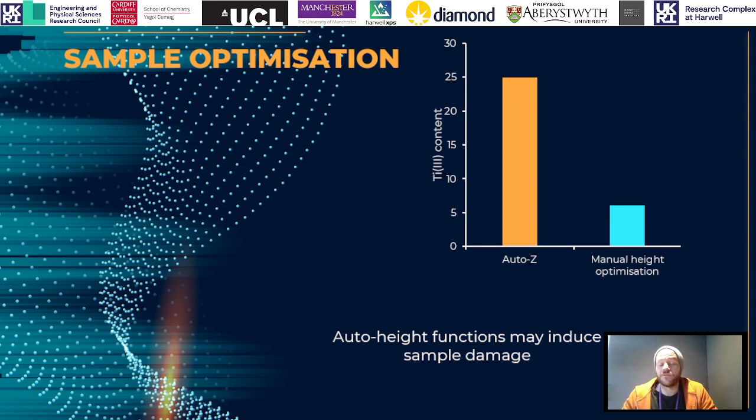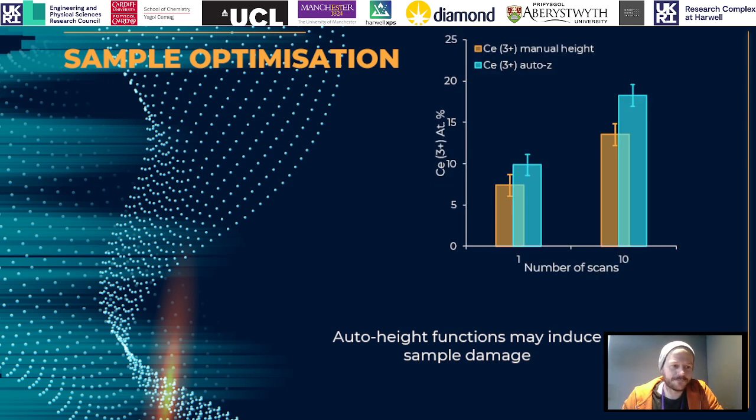It's also perfectly acceptable to use the auto height function on one location and then move to another part of the sample which is at the same height but hasn't been exposed to X-rays already. So this is just another example of cerium 3+ to show that we see exactly the same thing. This was actually on a different spectrometer. The previous was run on our Kratos Supra, this is run on our Thermo Nexsa. They've both got auto height functions, just showing that we do see exactly the same thing regardless of the system.